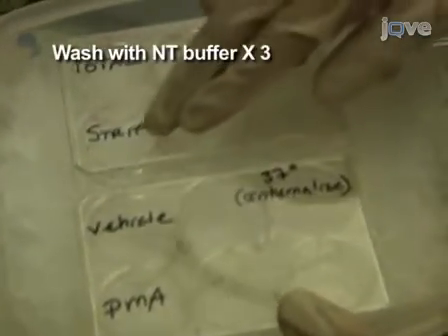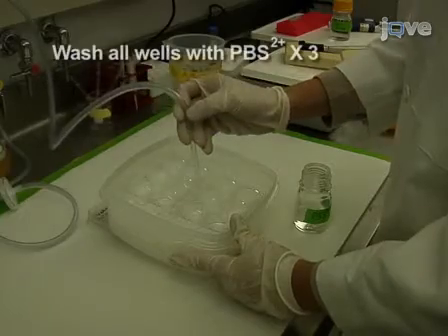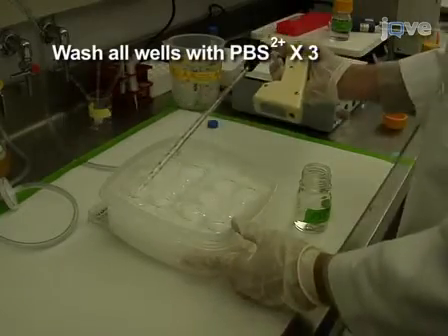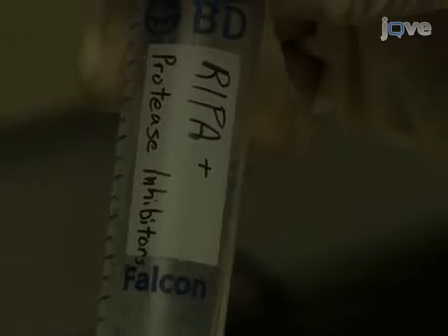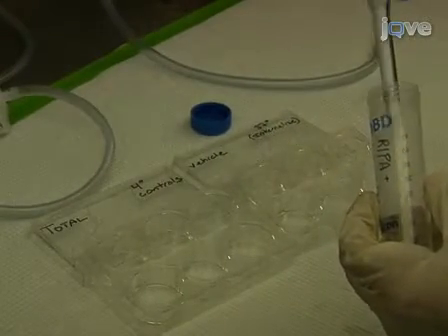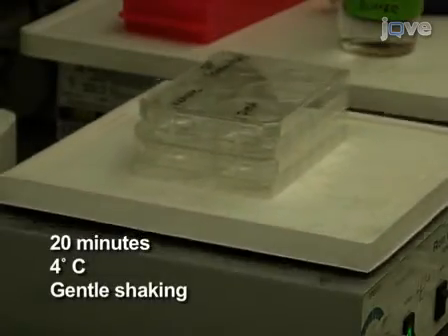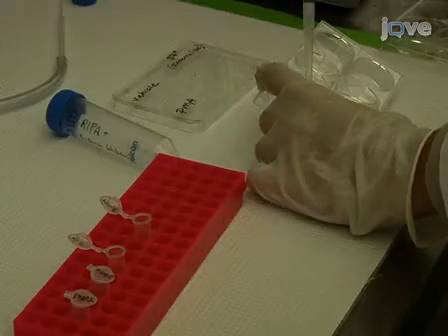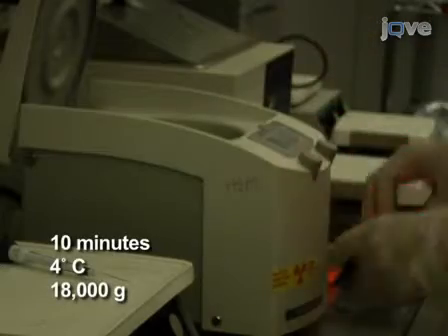To lyse the cells, first wash all wells exposed to stripping solution three times with 2 milliliters of NT buffer. Then wash all wells including total controls three times with 2 milliliters of cold PBS2+. Following the last wash, add 300 microliters of RIPA buffer containing fresh protease inhibitors to each well. Lyse cells by shaking for 20 minutes at 4 degrees Celsius, then transfer lysate to 1.5 milliliter microfuge tubes and clear cellular debris by centrifuging for 10 minutes at 18,000 g at 4 degrees Celsius.